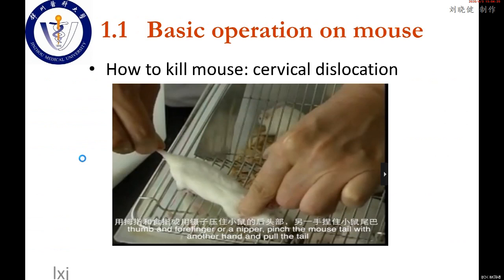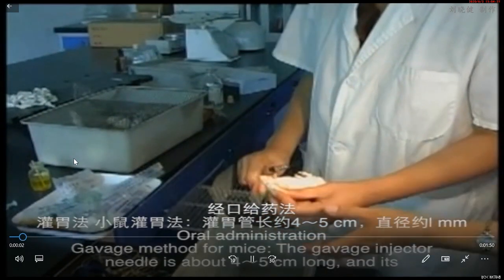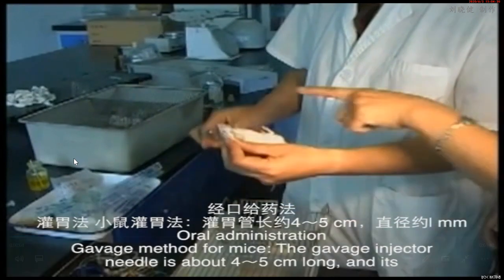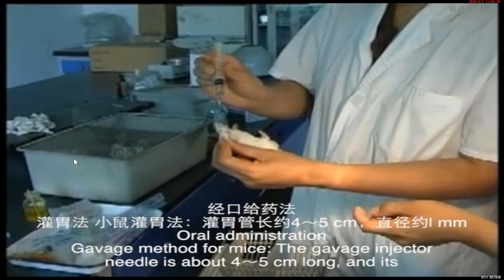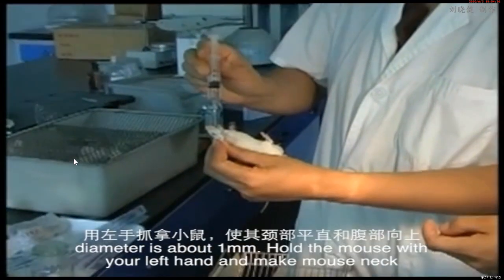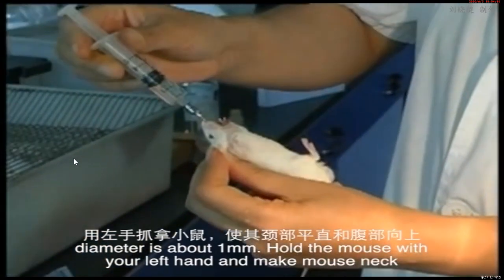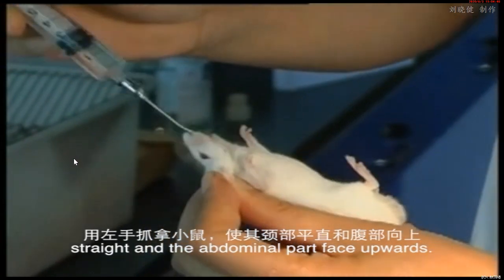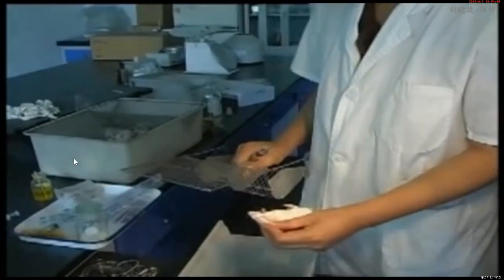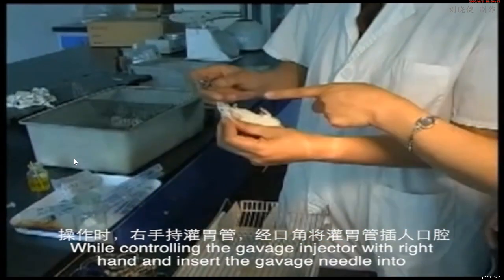Oral administration. Gavage method for mice. The gavage needle is about 4 to 5 cm long, and its diameter is about 1 mm. Hold the mouse with your left hand and make the neck straight, with the abdominal part facing upward.